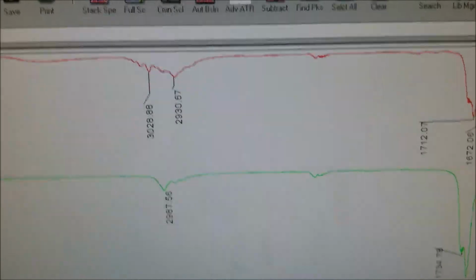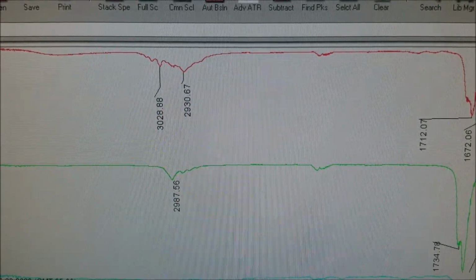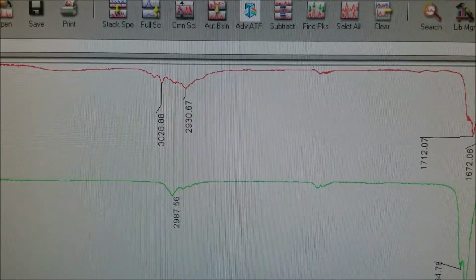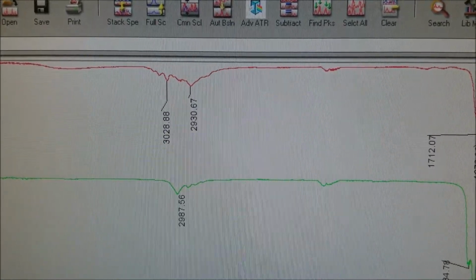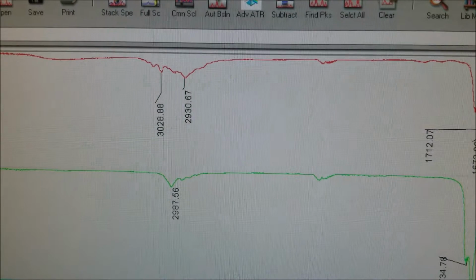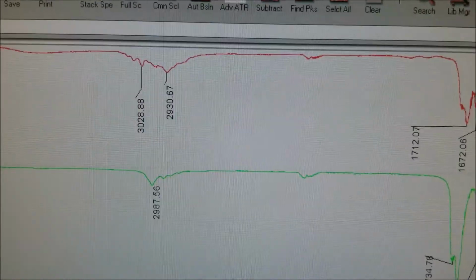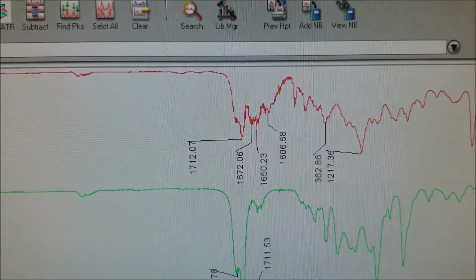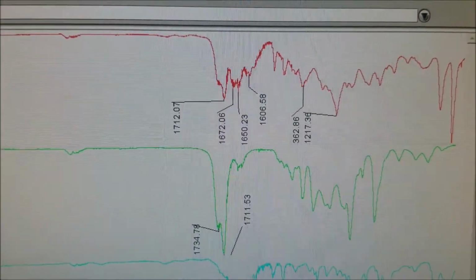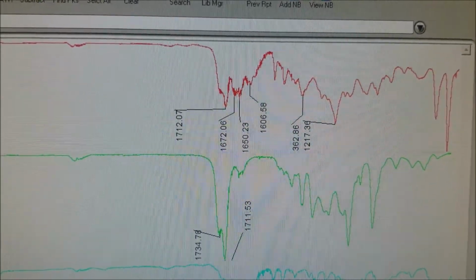Now here with our run, we still see the 3028 peak, which would be part of the phenyl group and our alkene. We see a new 2930 peak, which would be the sp3 hybridized carbons we have just added, both through the ethyl acetoacetate and part of the reaction that suddenly makes some CHs sp3 hybridized instead of sp2. We still see some of the carbonyl stretches at 1672 and 1712. They've changed a bit, but remember there's still a carbonyl in there, and especially an ester peak.